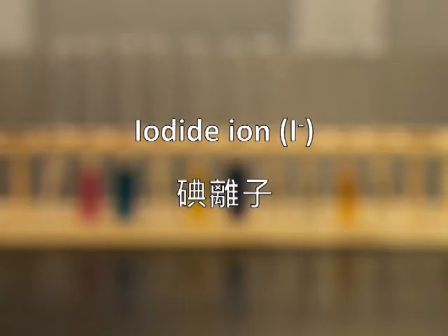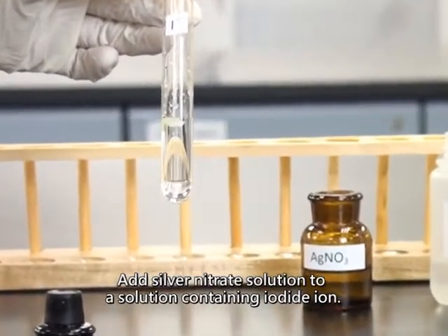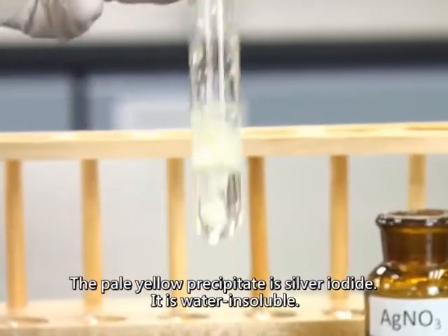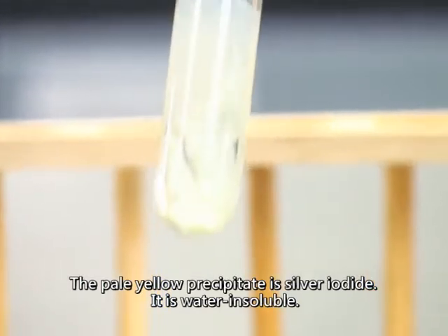Iodide ion. Add silver nitrate solution to a solution containing iodide ion. A pale yellow precipitate is formed. The pale yellow precipitate is silver iodide. It is water insoluble.